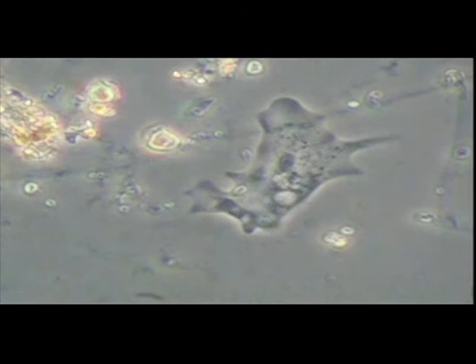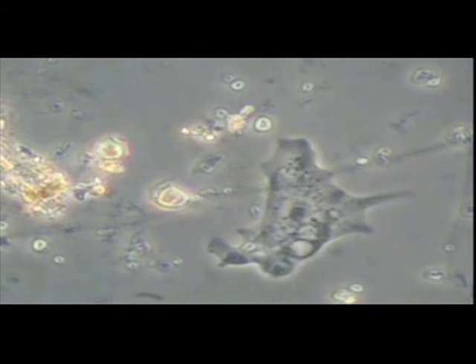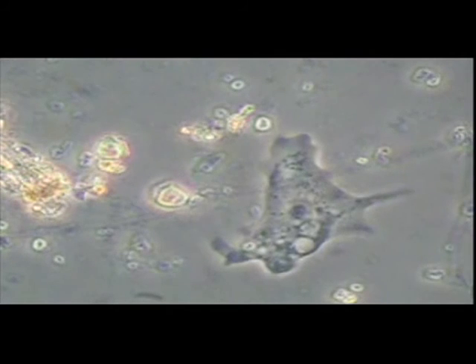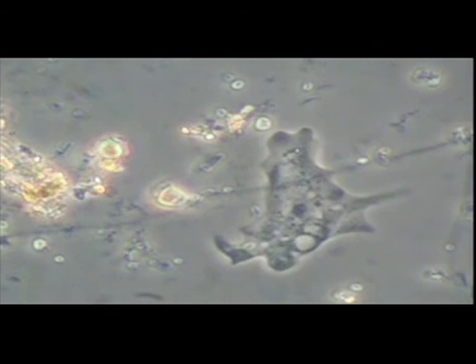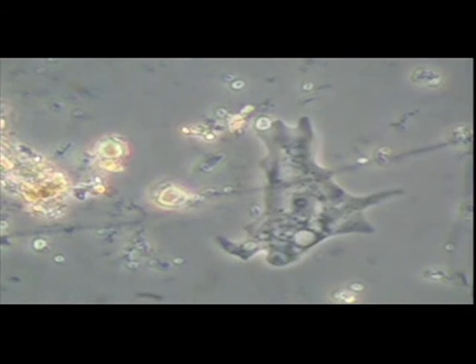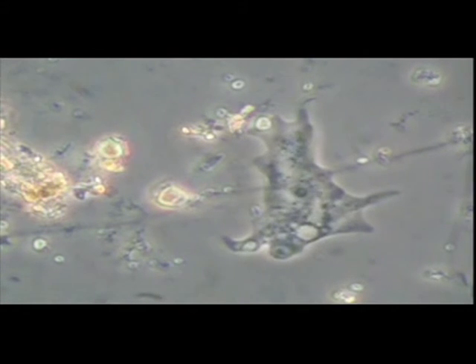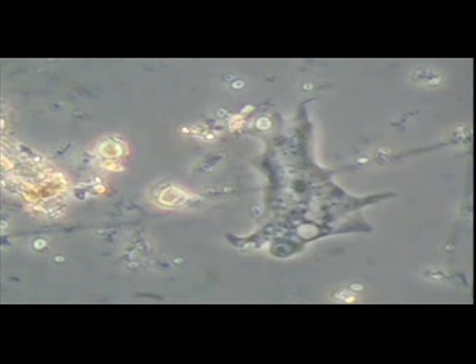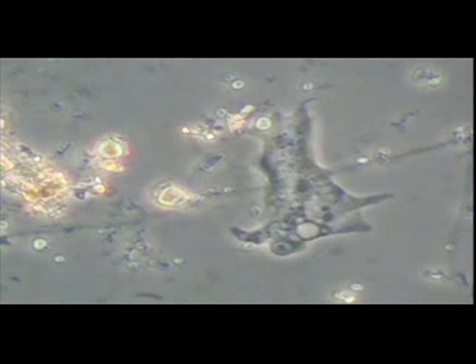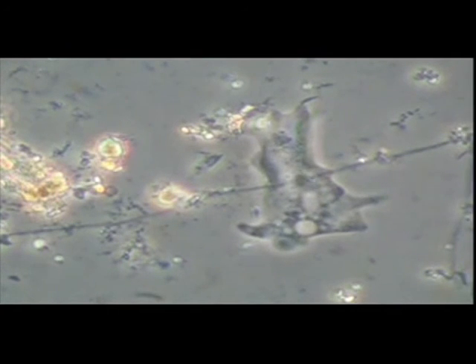Here we have a larger amoeba, a species of Mayorella. Instead of a monopodial pseudopodium, it has several finger-like pseudopodia. If you watch the posterior part of the body, you will see that this amoeba excretes a group of particles that subsequently stay together and do not readily disperse. It is possible that these particles are enclosed in a membrane. If this assumption is correct, it may have important consequences for further decomposition. The rapid movement of many particles within this amoeba is a good demonstration of the living nature of this organism.